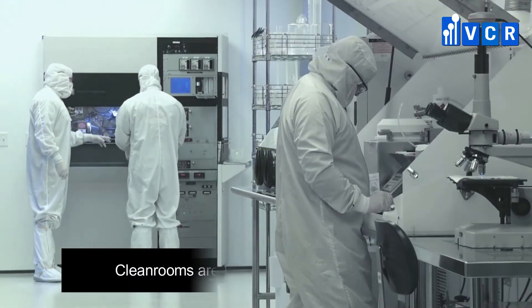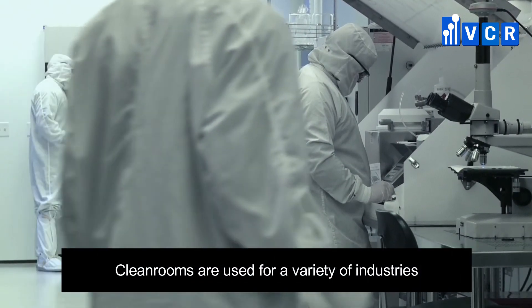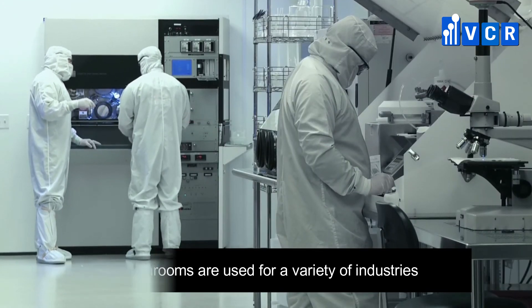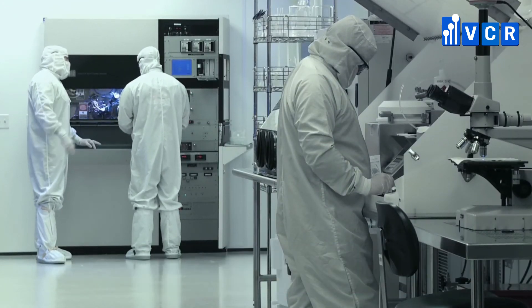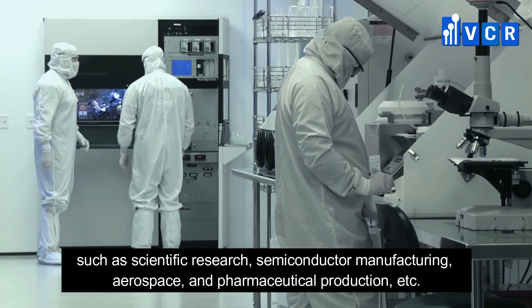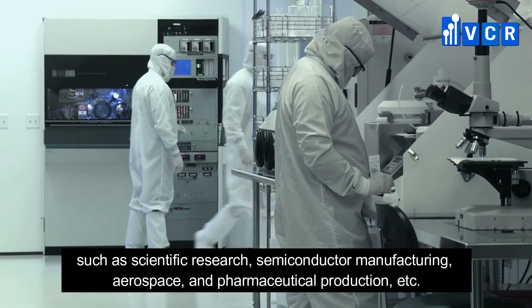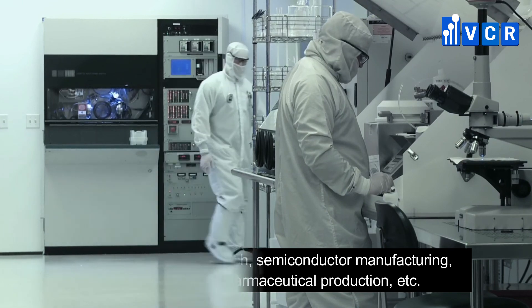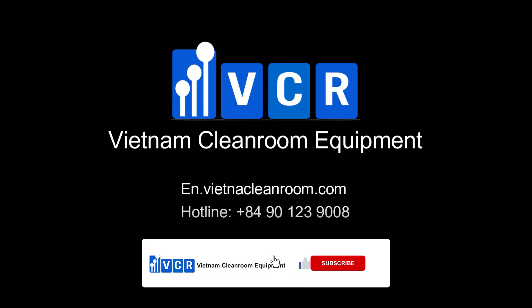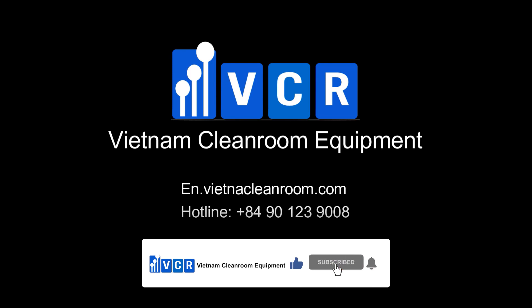If you're manufacturing products that are easily affected by particles in the air, it's likely that you'll need a clean room. Clean rooms are used across a variety of industries such as scientific research, semiconductor manufacturing, aerospace, and pharmaceutical production, and so on.